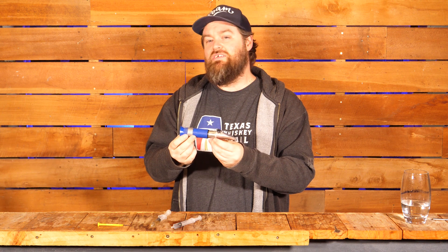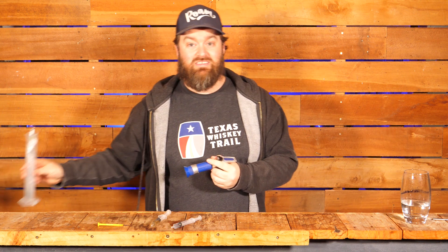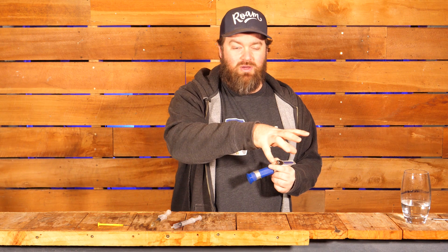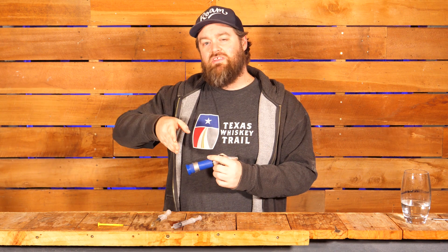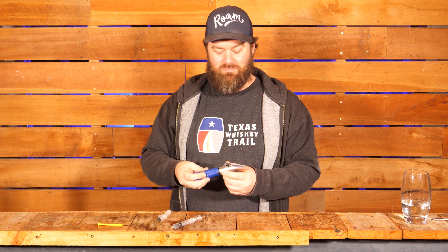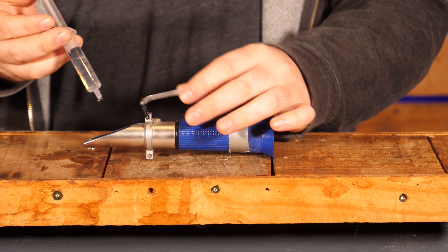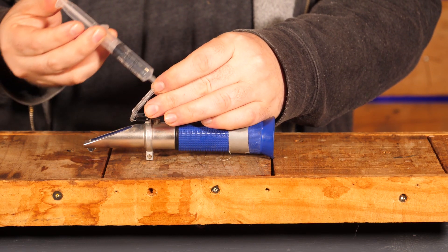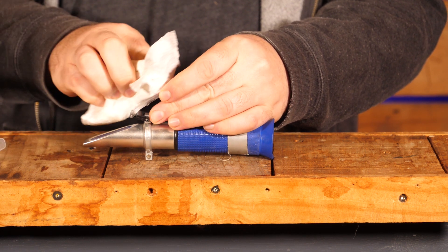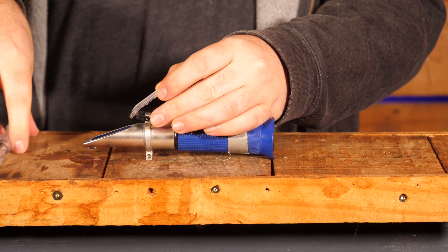I want to run through the proper way to use this thing. I'll almost guarantee some of you are going to say 'screw that, it looks like far too much energy and time — I'll stick to using a hydrometer.' I can understand where you're coming from. Let me show you the proper way first, and then I'll show you the way I actually do it when I'm using it for distilling. First up, give it a little rinse with distilled water, just to make sure there's nothing on there from last time. Give it a wipe down, ideally with a nice soft cloth, not a crappy paper towel.